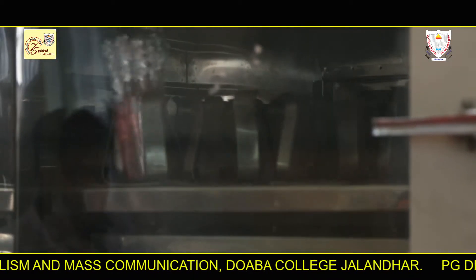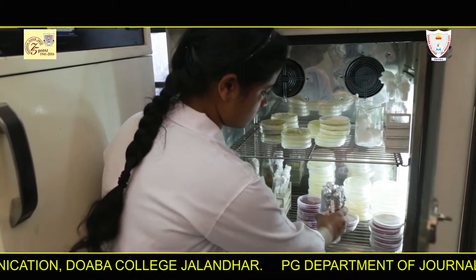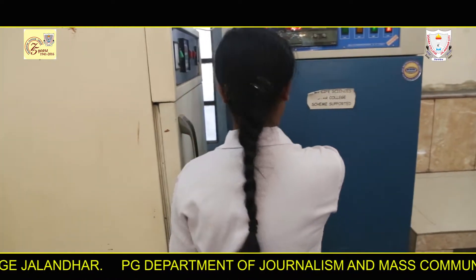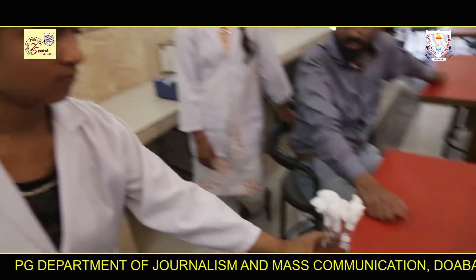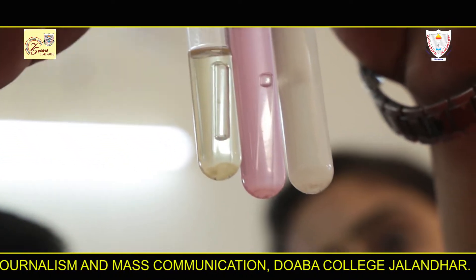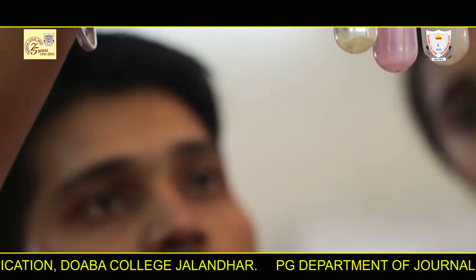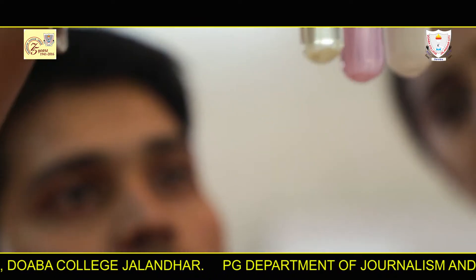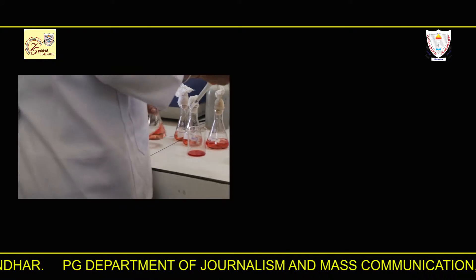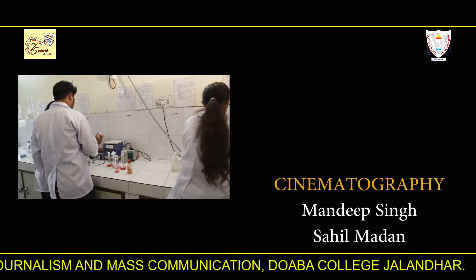These tubes are incubated at 30 degrees centigrade and the observations are recorded after 3 days. The observation shows a positive test, indicating a change in medium color from pink to yellow.